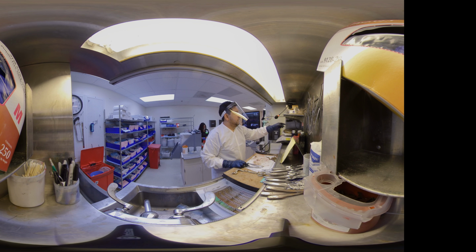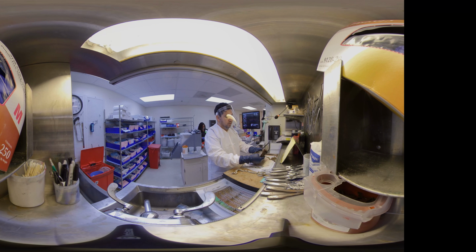This is a 595 gram, irregularly shaped, intact and complete singleton placenta, which measures 22.0 by 18.5 centimeters after trimming.